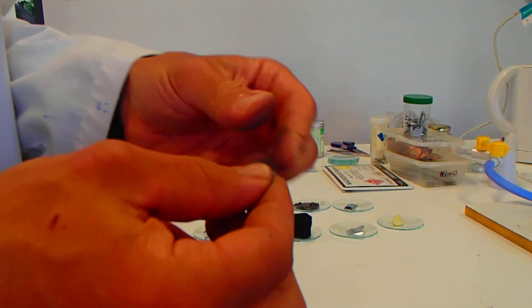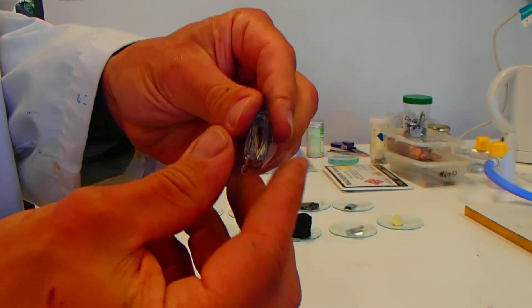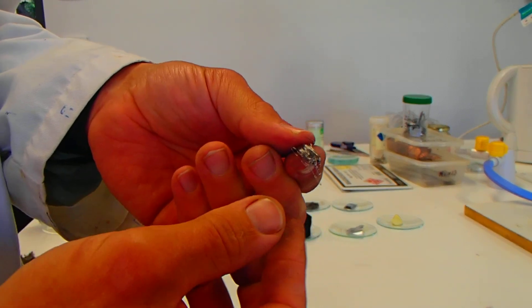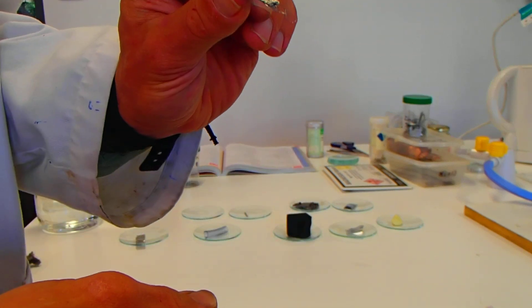Iron. This is wire. So of course, you might think it's not quite easy to bend. And it is. A little bit stiff, but easily bent. Keeps its shape. Doesn't crumble. Doesn't tear. That's the iron.